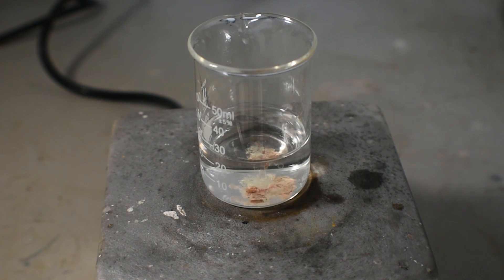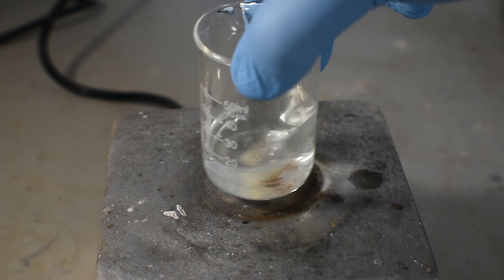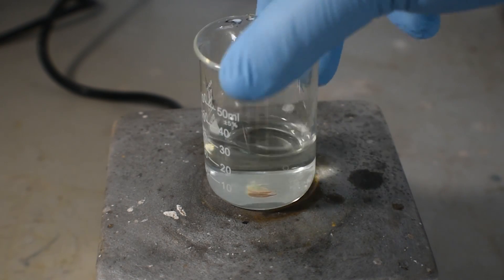When the salt is added, a white precipitate can be seen. This is caused by the copper-1 present in the salt reacting with the acid to form insoluble copper-1 chloride.